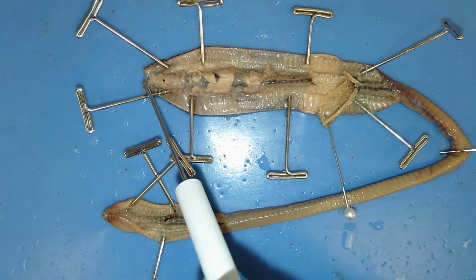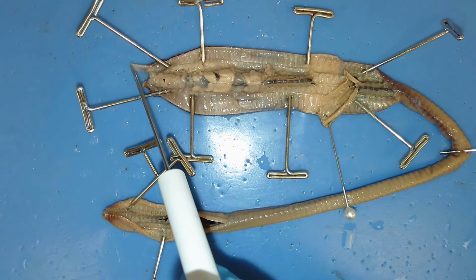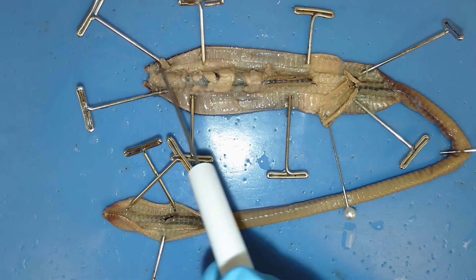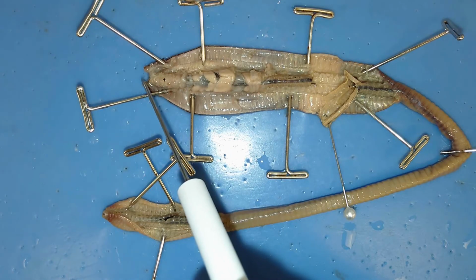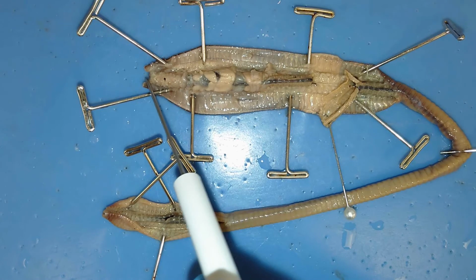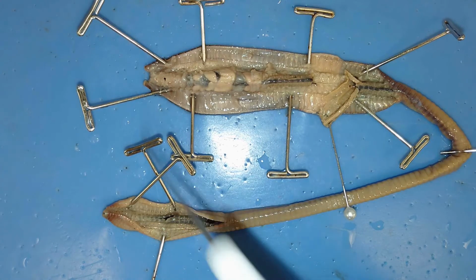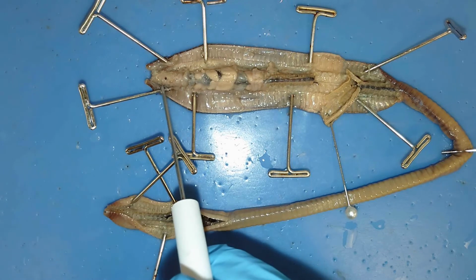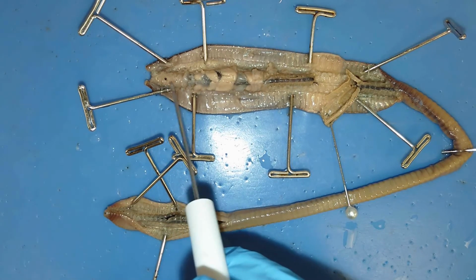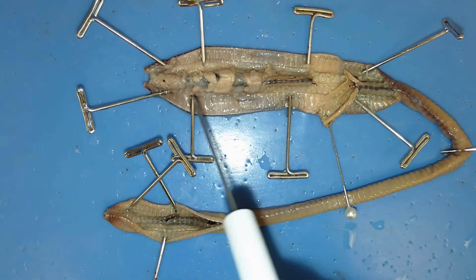So we mentioned the mouth, so food's going to be coming in through this hole right here. If you look at the way I cut this individual, let me get this septa out of the way. These two lobes here and here, that's one half of the prostomium and another half over here. This divot right in the middle, that's where the mouth would be, and these two prostomium would be connected over top. Right behind the mouth is this structure here. This structure is called the pharynx, and so this acts as a pumping structure to pump food into the mouth and down the rest of the intestinal tract and the digestive system.